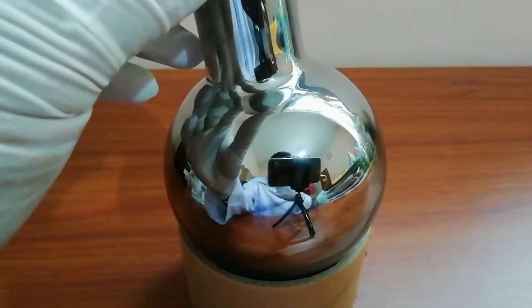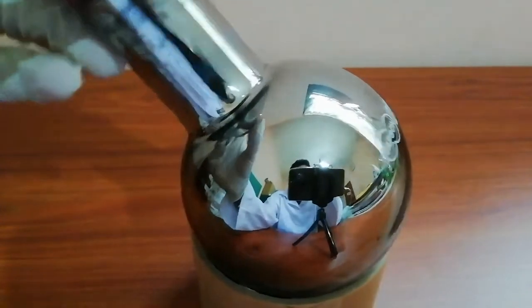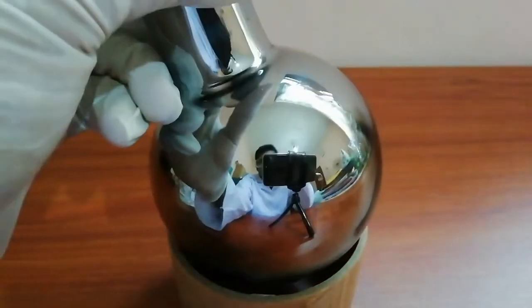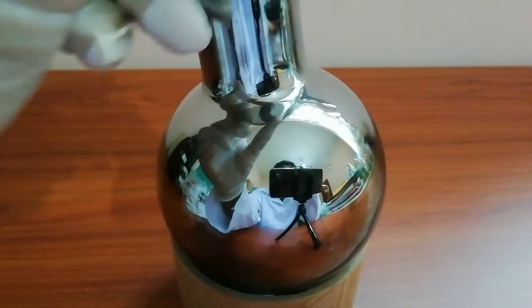Now you can see our final result. Here is the mirror. There are some black spots in the flask because of some impurities left. This is the final result.